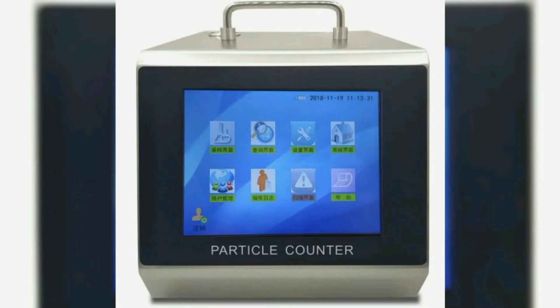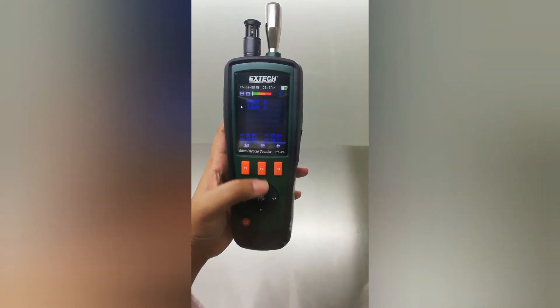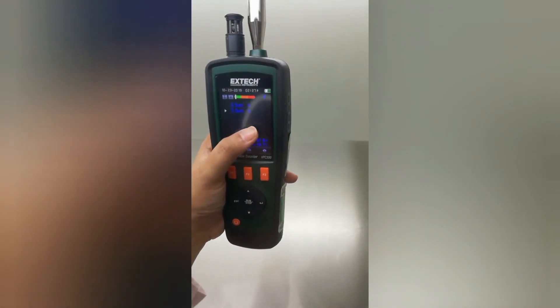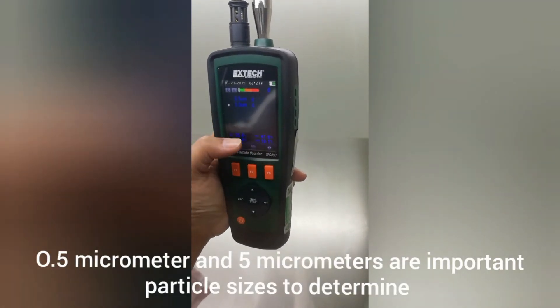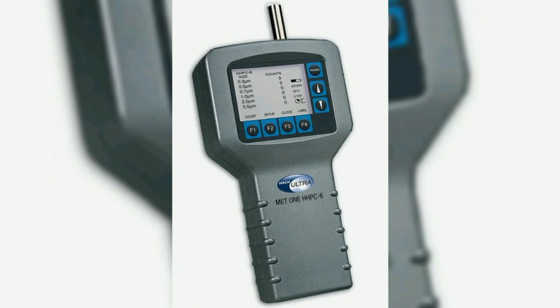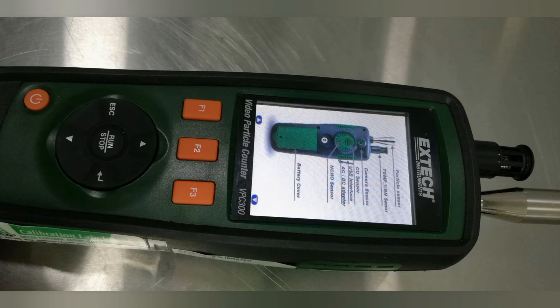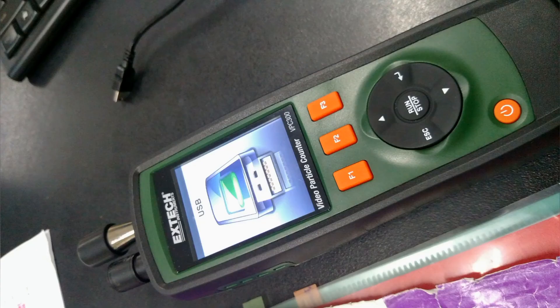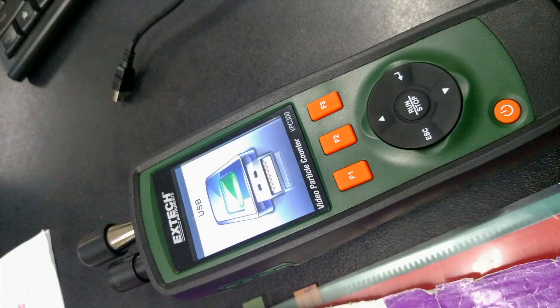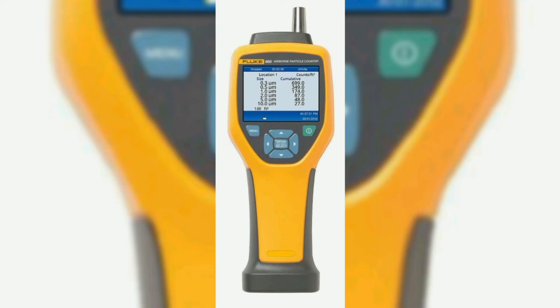A particle counter is an instrument that detects and counts physical particles. Particle sizes of 0.5 micrometers and 5 micrometers are important to detect in clean room and controlled environments. A particle counter is used to check the particles in the air of clean rooms or clean air zones. The particle count must be under the limits suggested by the WHO.